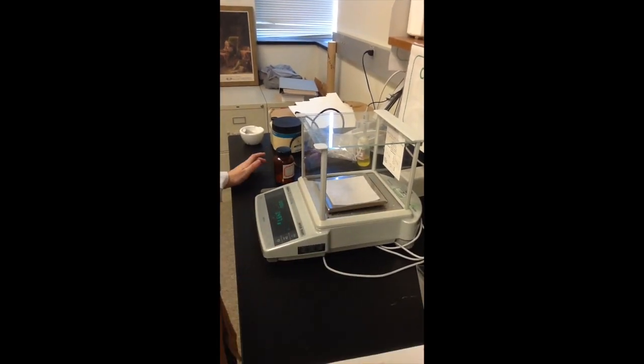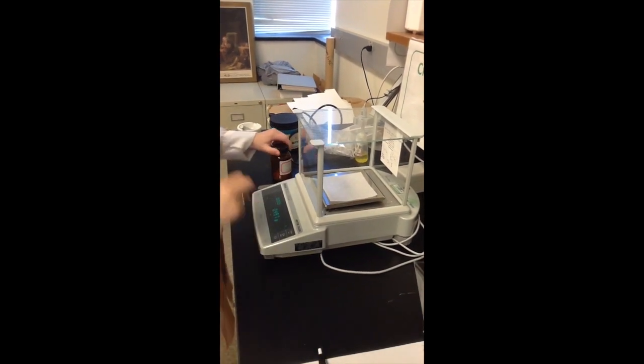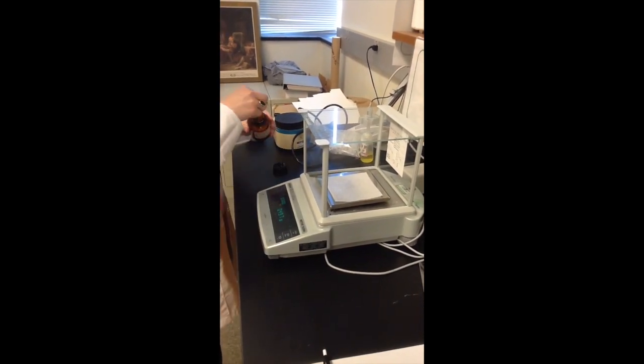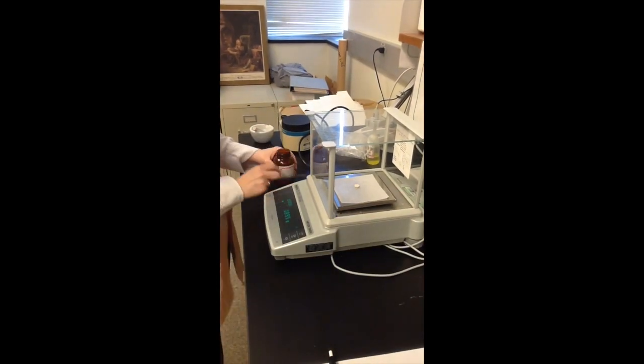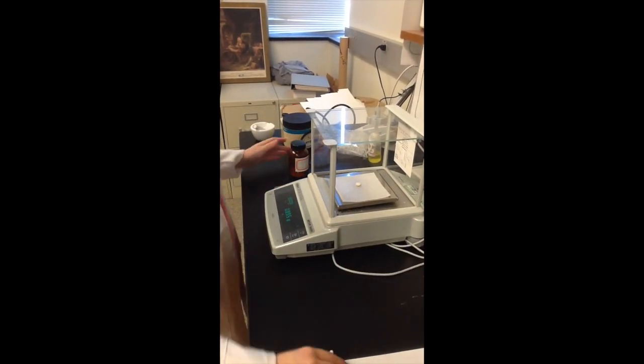First, weigh the weigh paper and record the mass. Then place one tablet onto the paper and record the combined weight. Next, weigh the other two pieces of weigh paper and record the mass of each.